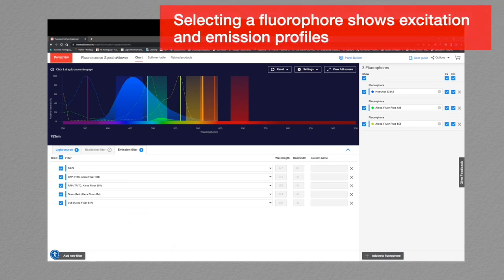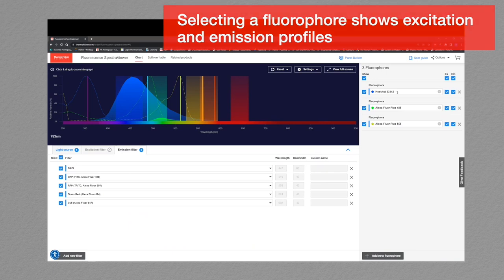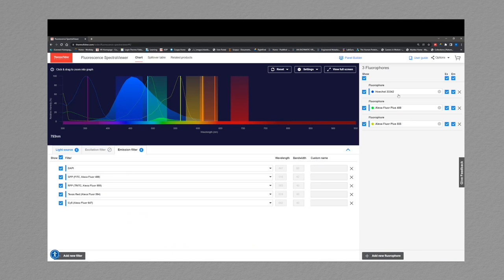The SpectraViewer comes preloaded with hundreds of different fluorophores. You can simply access this by typing your fluorophore of interest into this box, and it should pre-populate with fluors that match your description. So we'll go ahead and add a couple more fluorophores here. I'll start with Alexa Fluor Plus 594, and then we'll add Alexa Fluor Plus 647.